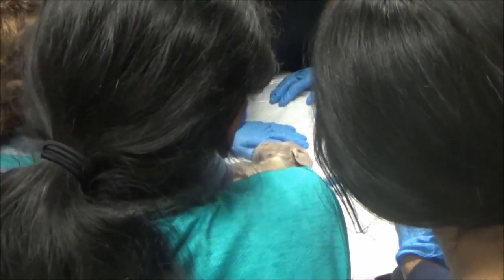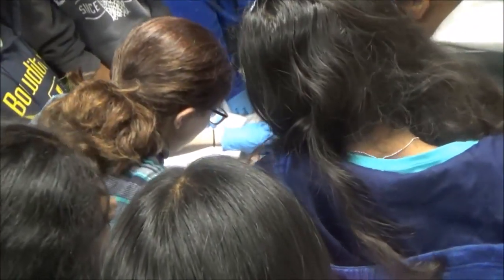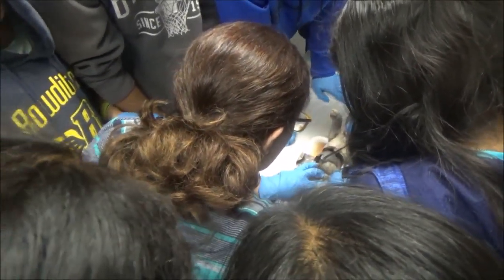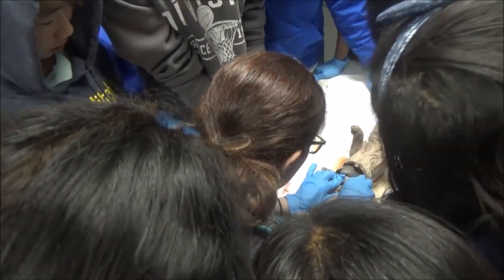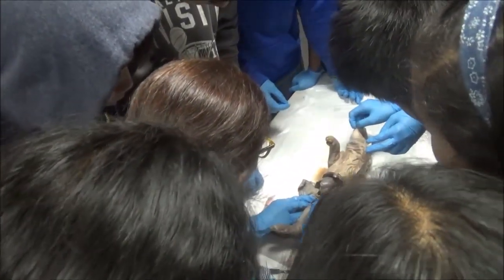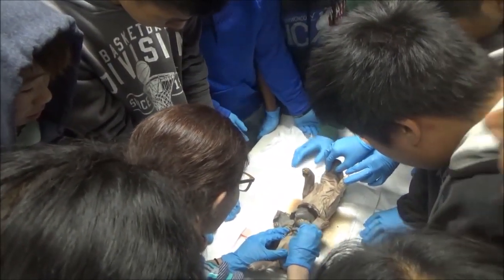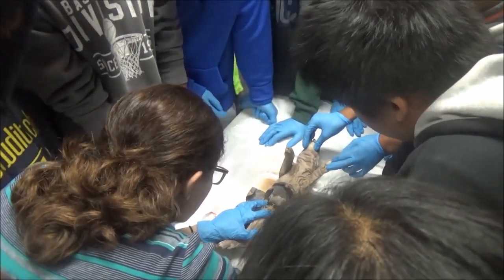We've been able to see small intestine and large intestine. Have we found the pancreas? Finding the pancreas is really hard because it's under the stomach — I'm going to have to start cutting things. Cut the stomach off. Is that a kidney? This is the kidney. Do you guys see this icky brown stuff? That's because I accidentally cut open the large intestine. The brown stuff's coming out — that substance is poop. Poop doesn't go in the stomach, that's in the intestine.